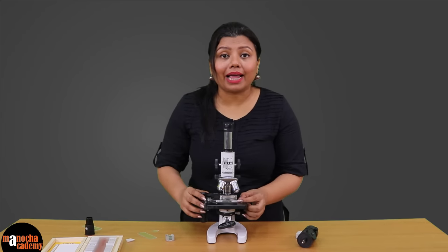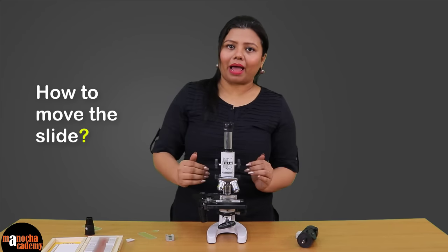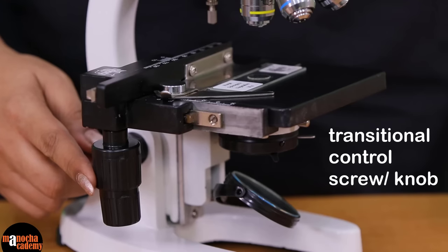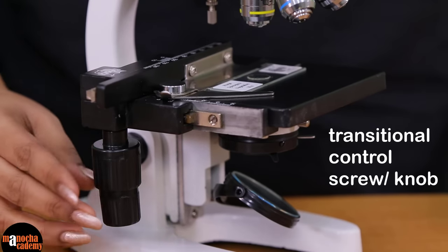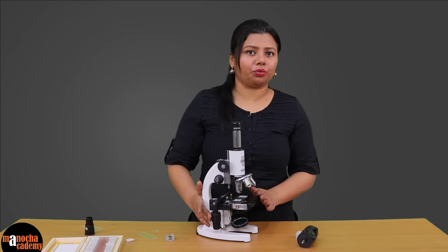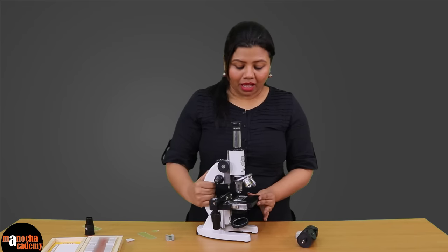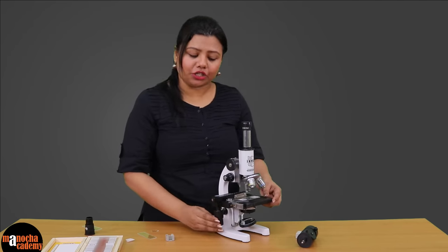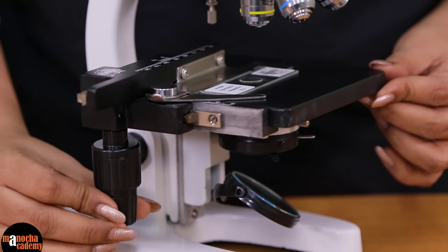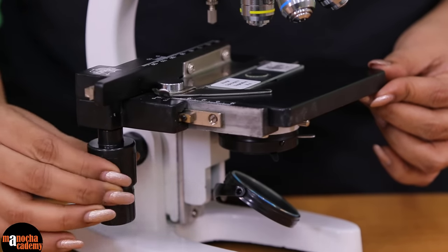You might have to move the slide right, left, forward or backwards. For that, you have usually this kind of screw attached to your microscope. Certain compound microscopes may not have the screw, in which case you have to manually move the slide. However, if you are provided with these screws, you can move them to move the slide right and left, backwards or forward.